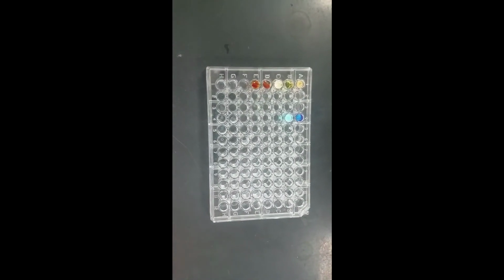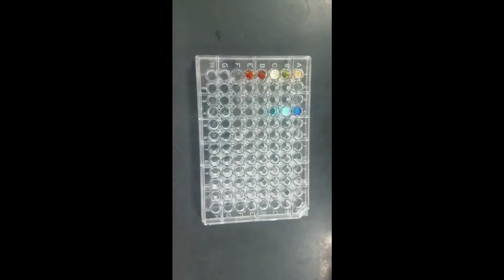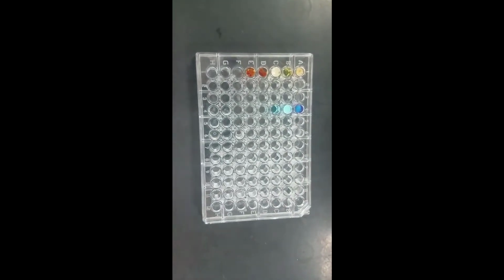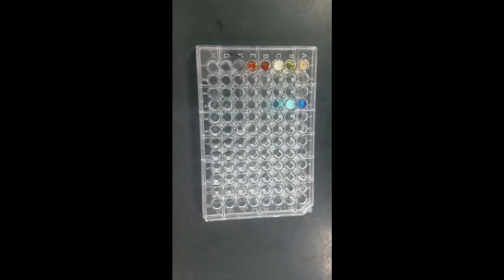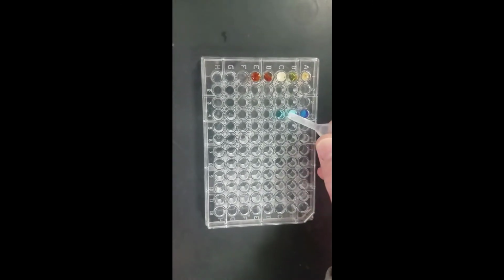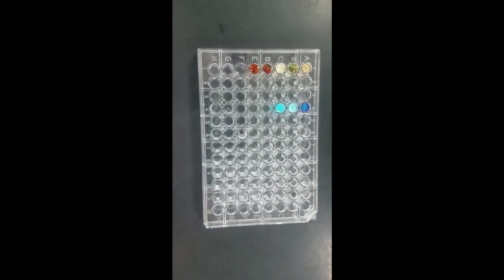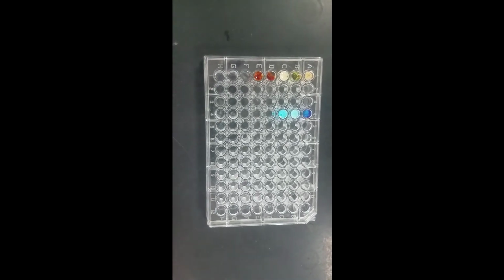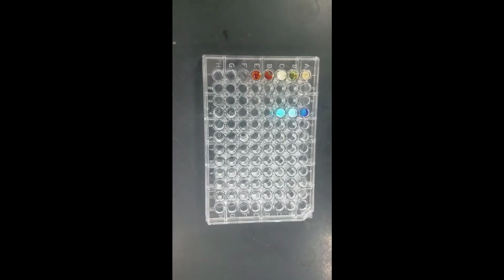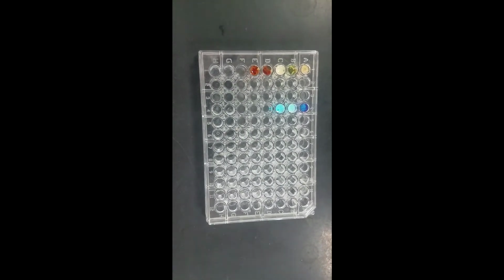All right, number 8 is copper sulfate, 2 drops, and I want to add sodium carbonate. You can see it's got a little darker blue and it looks like it's got cloudier. So there's evidence that a reaction took place. Write down the color and that it precipitated.